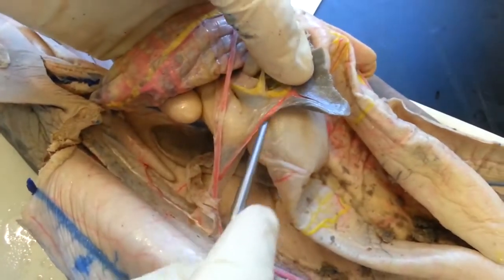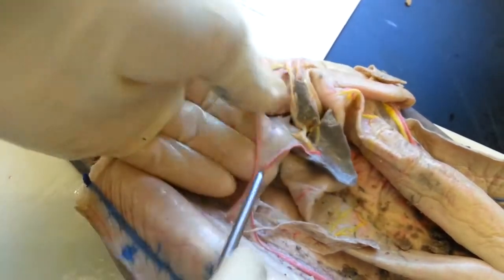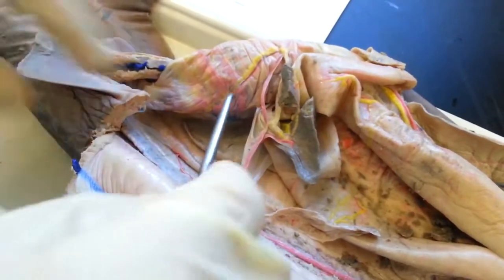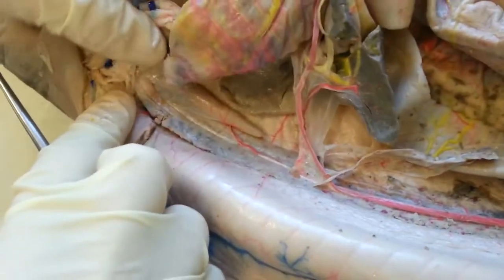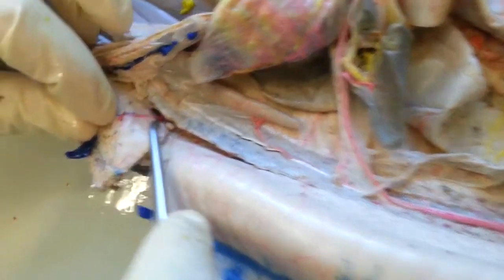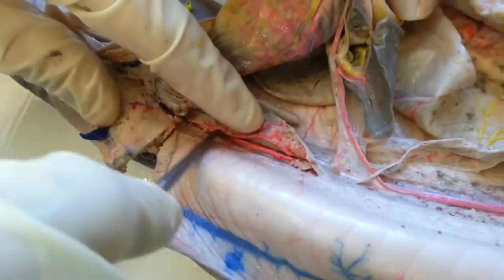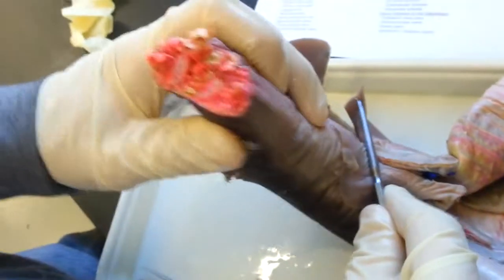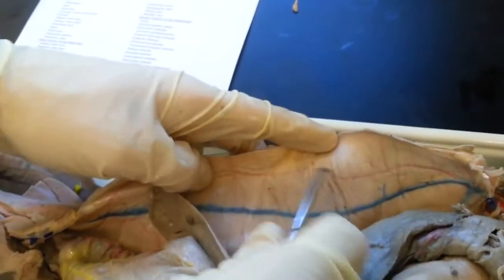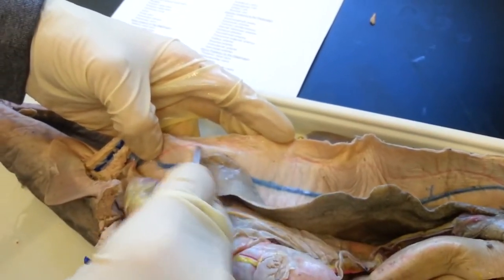The gastrosplenic artery goes to the spleen and also comes off the dorsal aorta — you can see where it crosses the anterior mesenteric. Then you have the posterior mesenteric artery, which goes to the digitiform gland. The iliac artery is one on each side. The caudal arteries go under the kidneys and out the back of the tail. And the posterior ventrolateral arteries run down the abdominal wall. That's all the arteries.